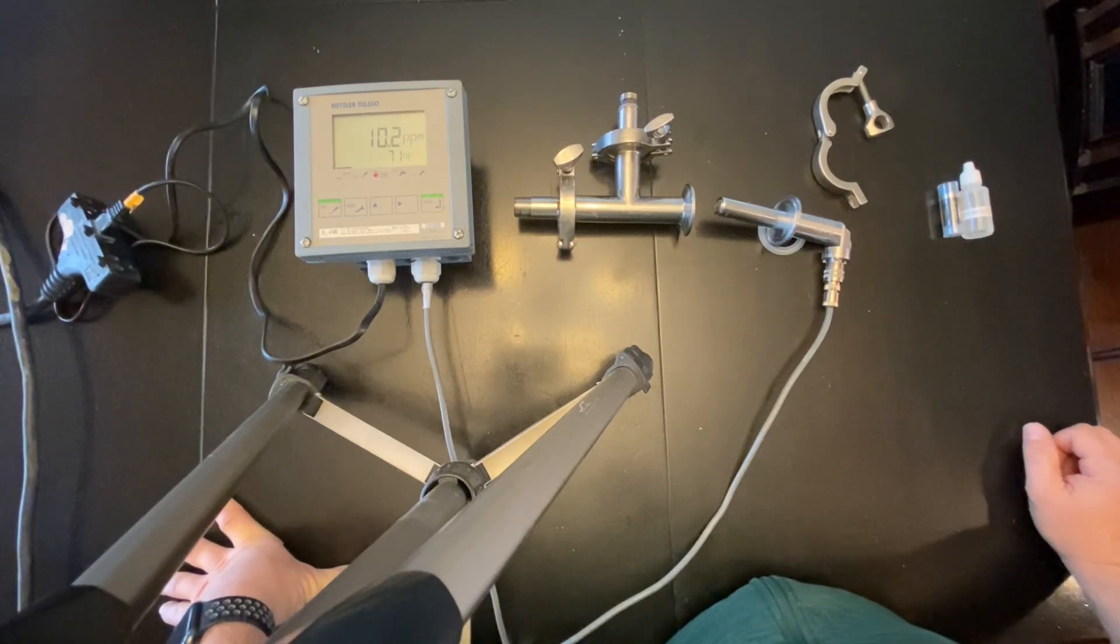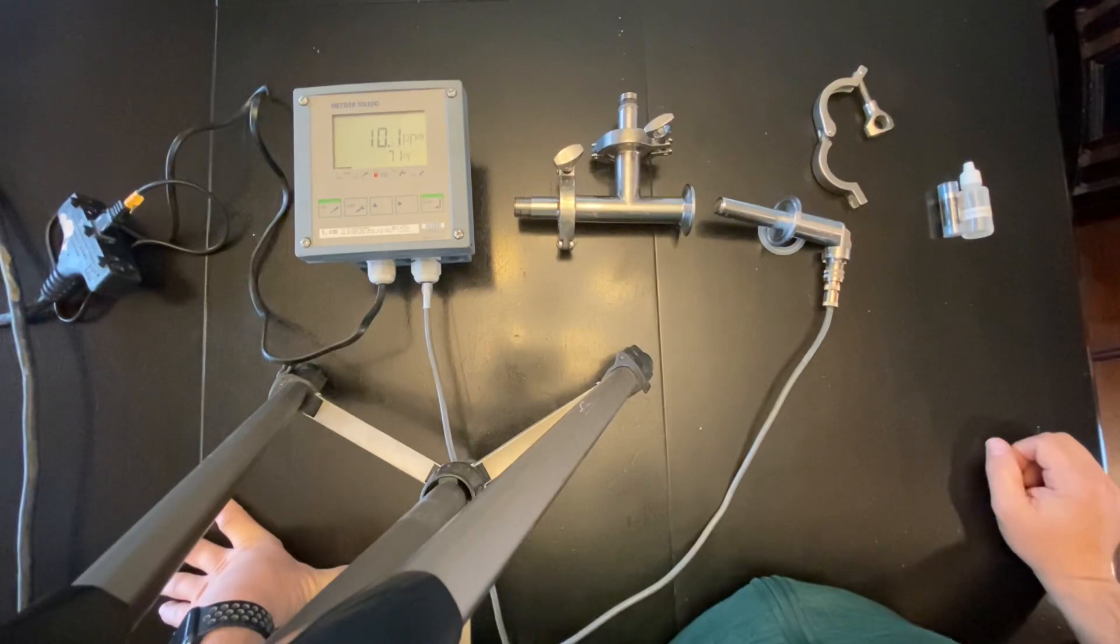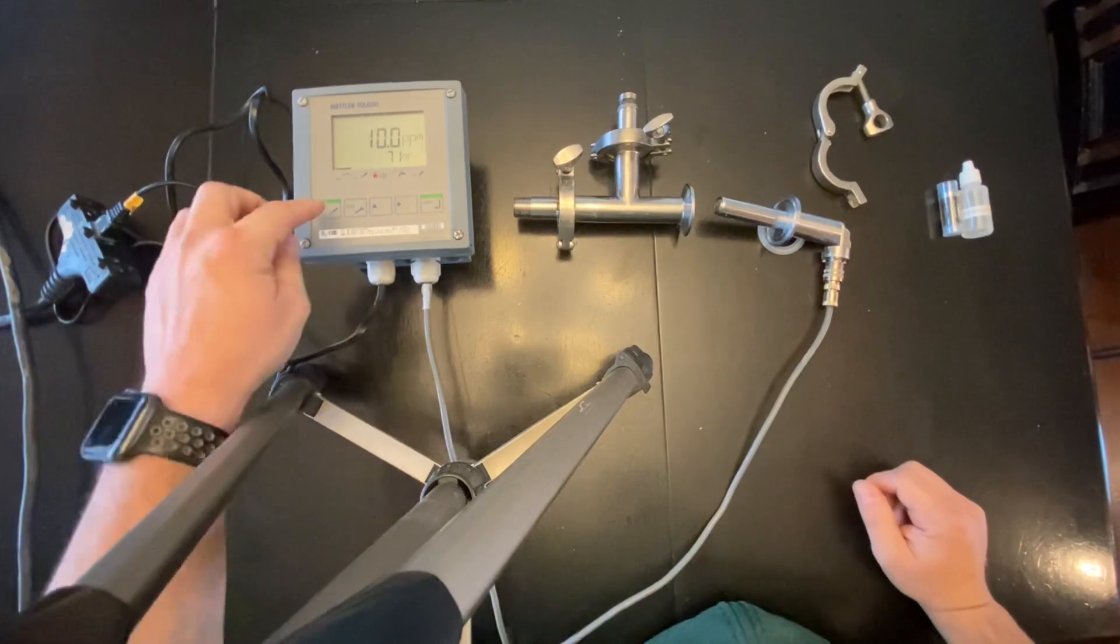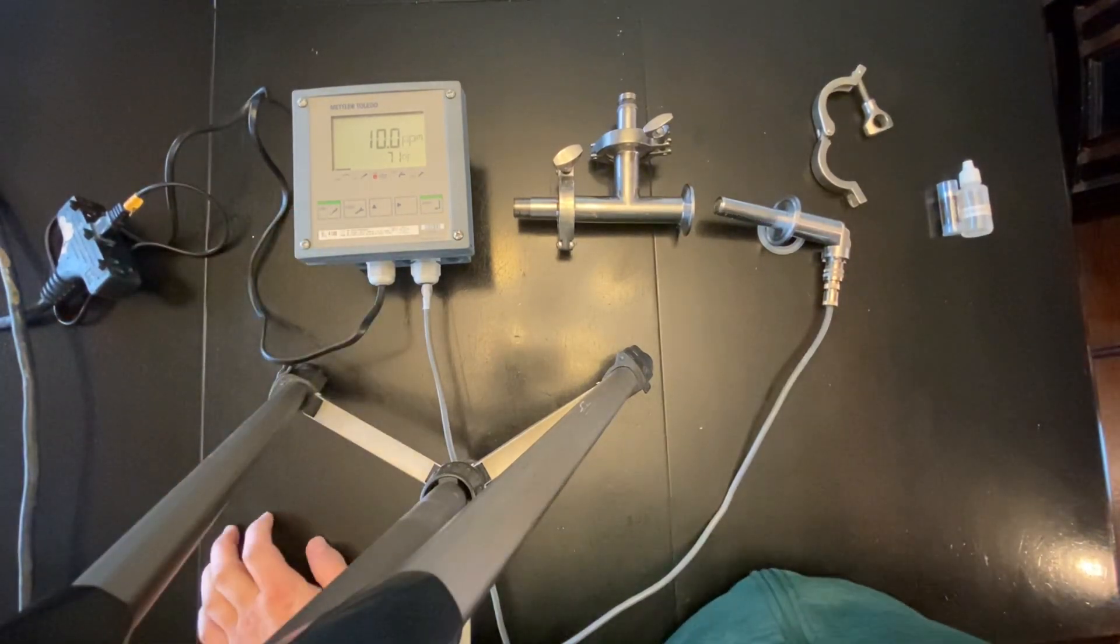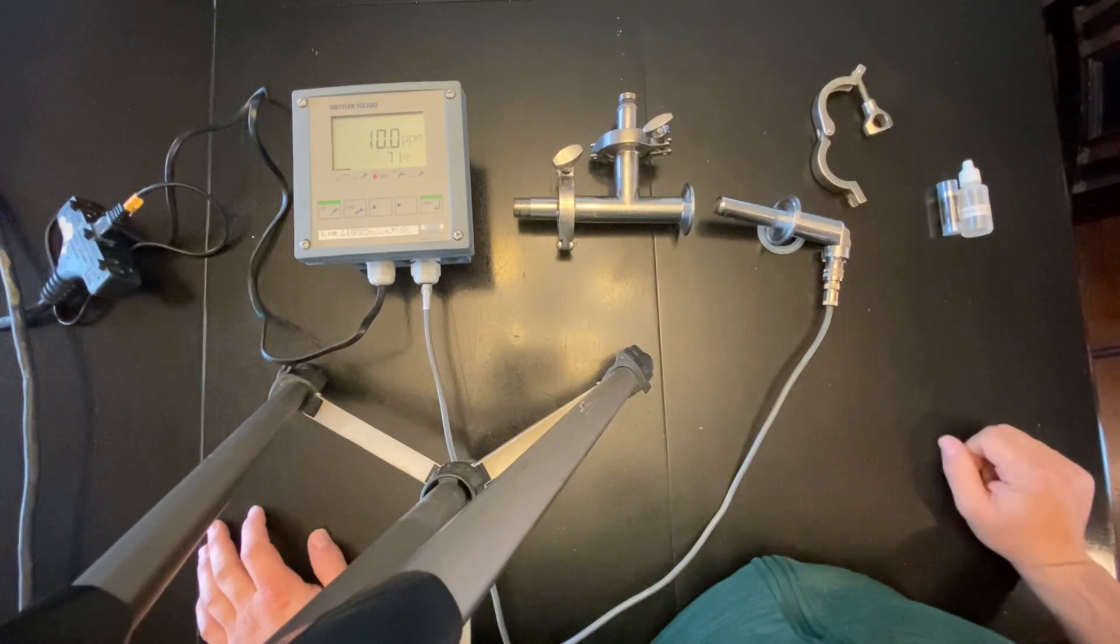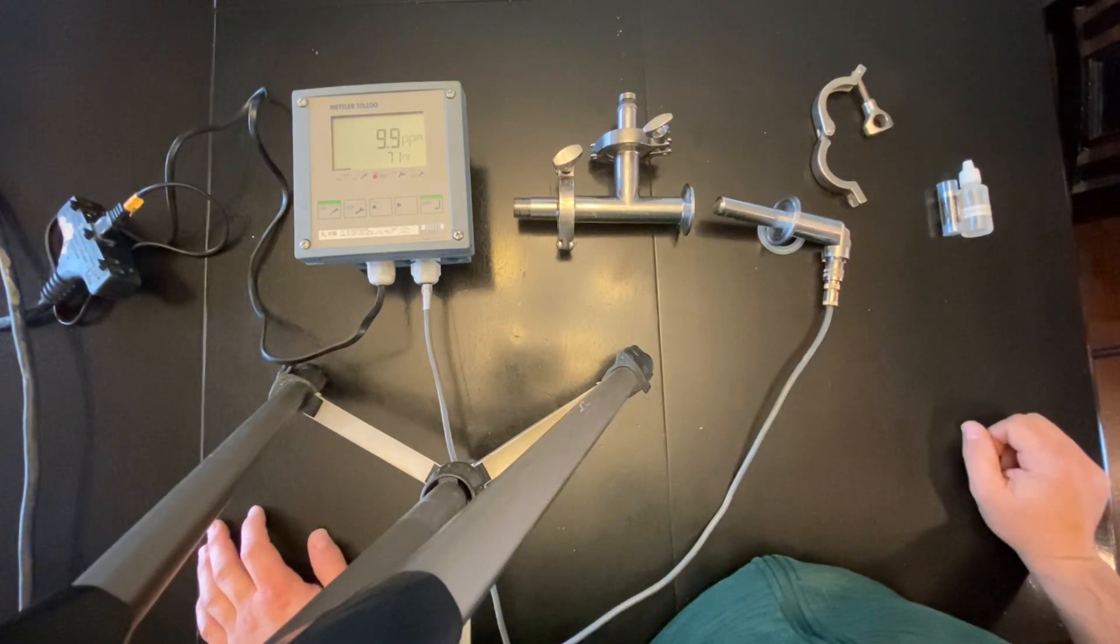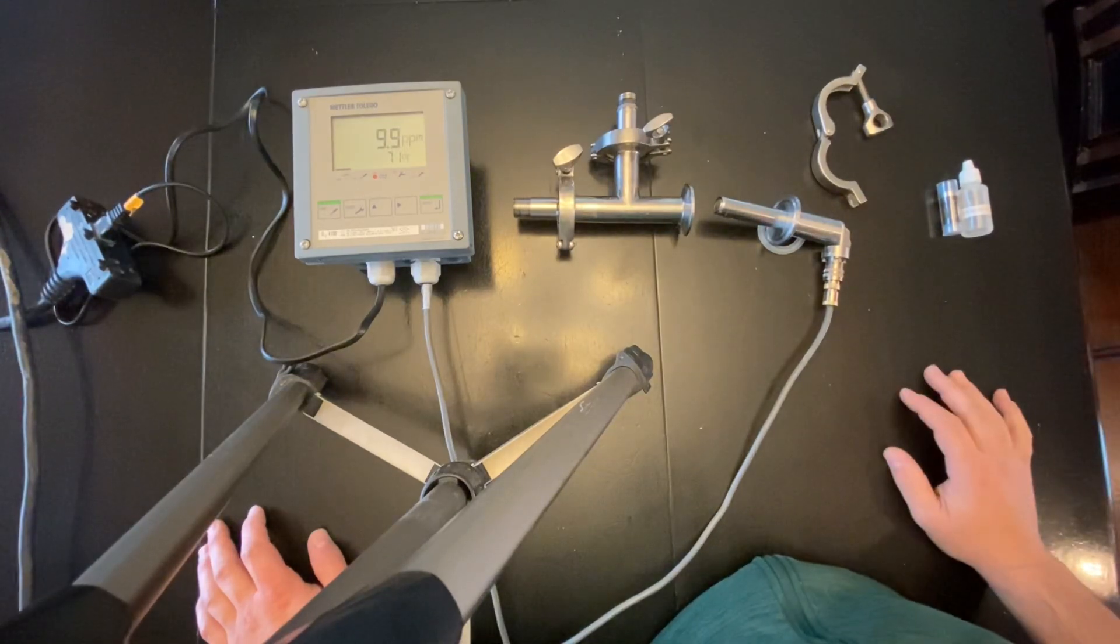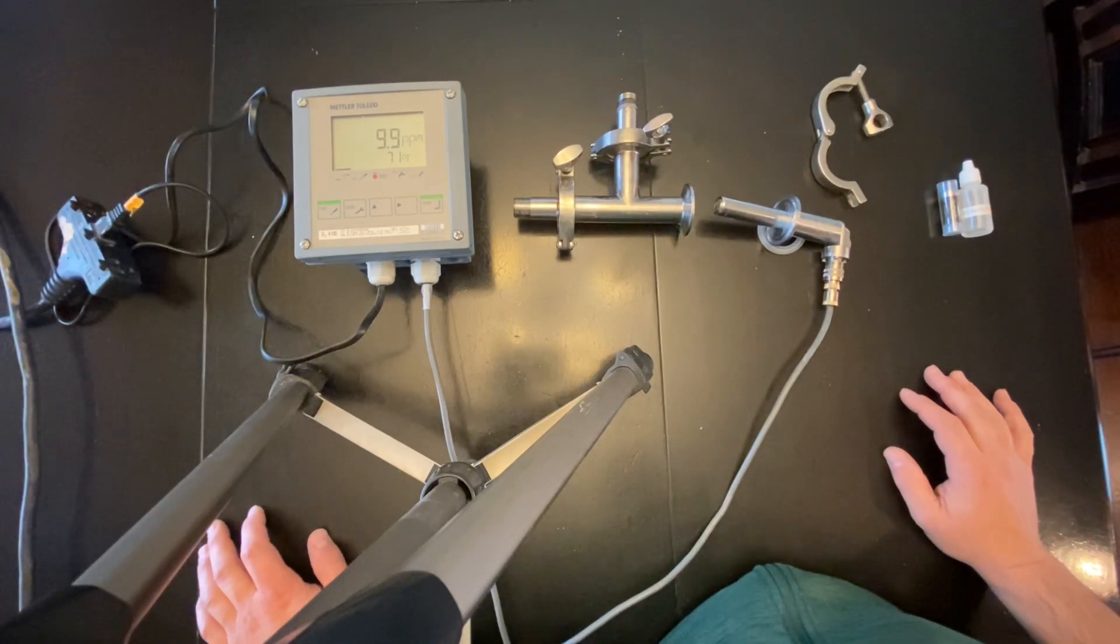When you're done using it, you don't have to, but it's super easy to calibrate. All you do is hit this calibration button and I'll run through it in another procedure, but it's really easy. It takes less than a minute to calibrate, so every time I go to use this I do calibrate the unit just for sheer simplicity and then you don't have to guess.